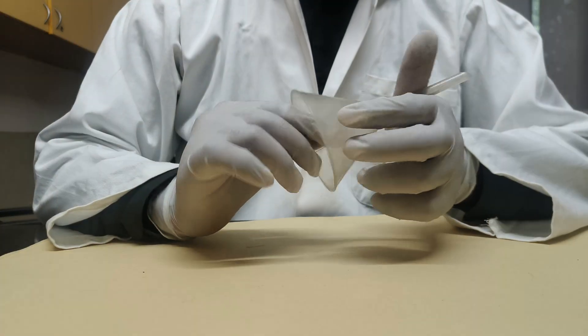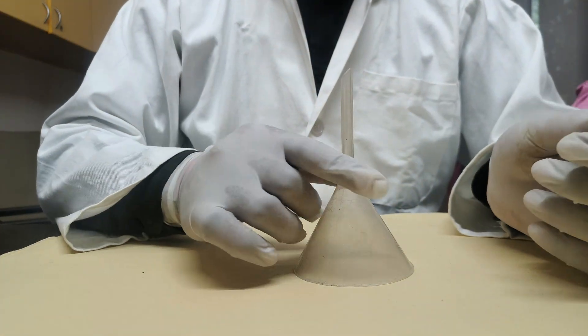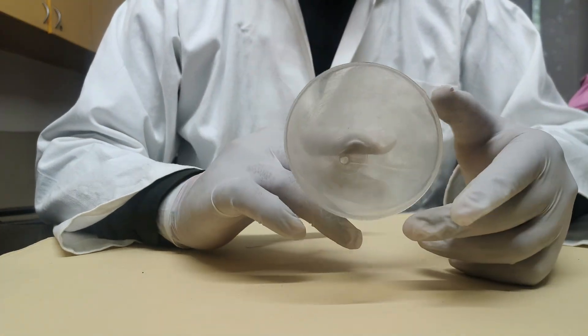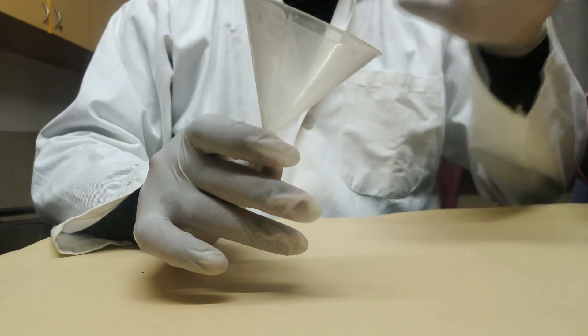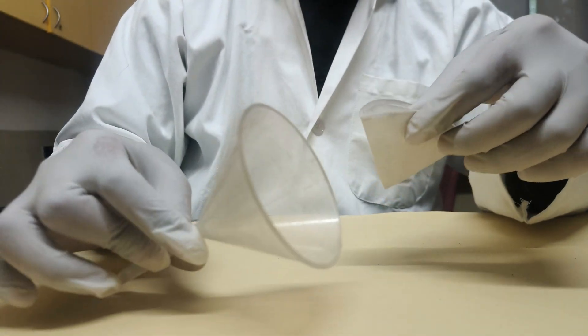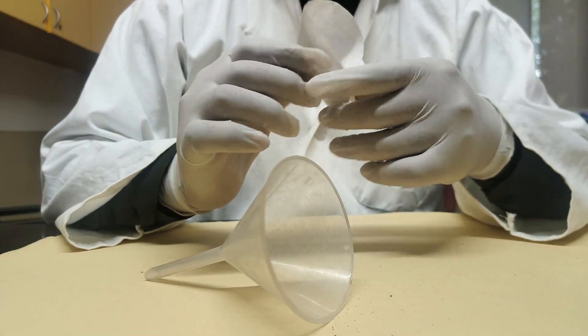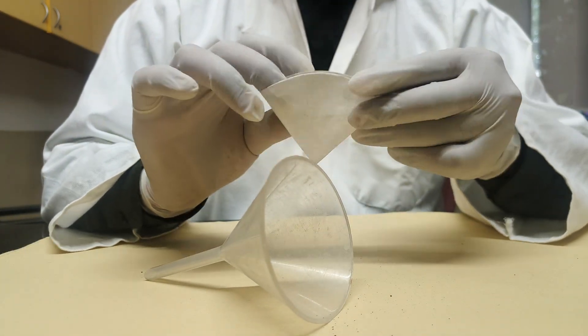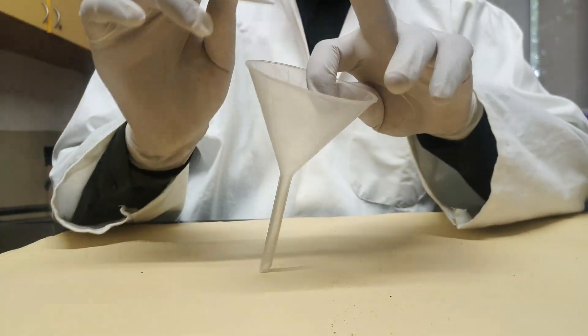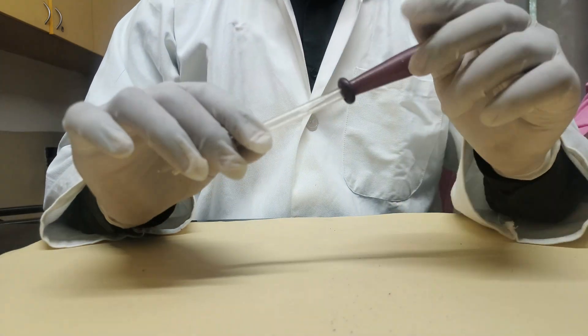Next is the funnel. It is used to pour any chemical into bottles and is used with filter paper. As you can see in the video, we fold the filter paper into one third and place it in the funnel, which allows us to separate any liquid from solids.